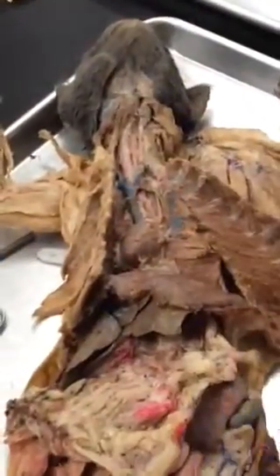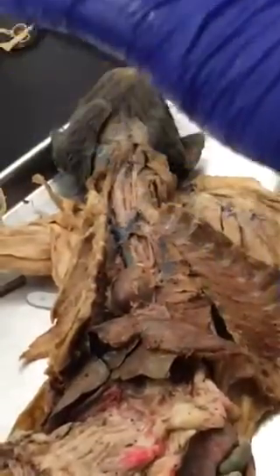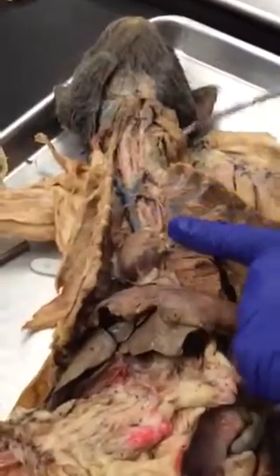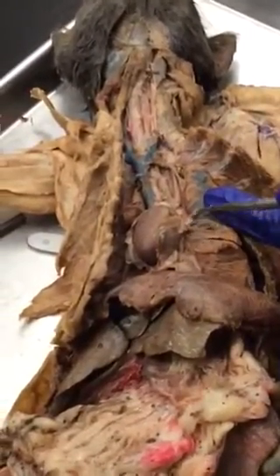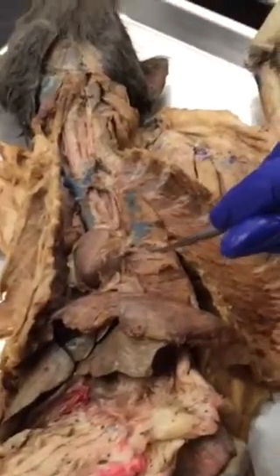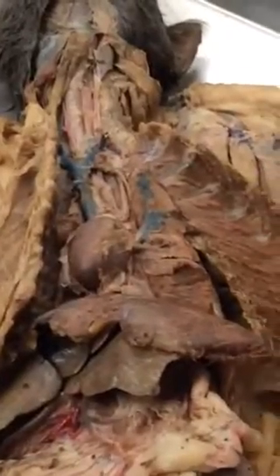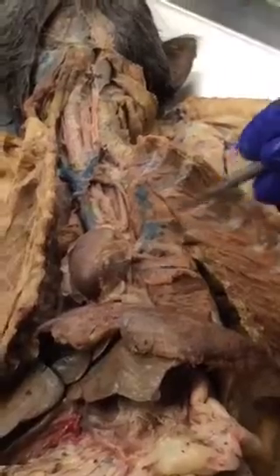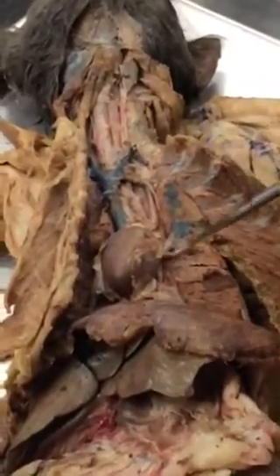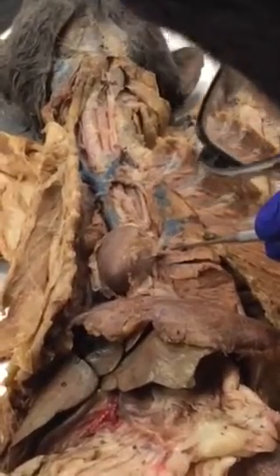In the middle below the heart there is a small lobe hidden there — that is the accessory lobe. You will find tube-like structures going into the lungs. The biggest one will be the primary bronchus. The trachea branches into primary bronchi. The primary bronchus continues and makes another branching — that branch is the secondary bronchus. You have to dissect away tissue to find the secondary bronchus; we don't need to see the tertiary one as it is too deep.